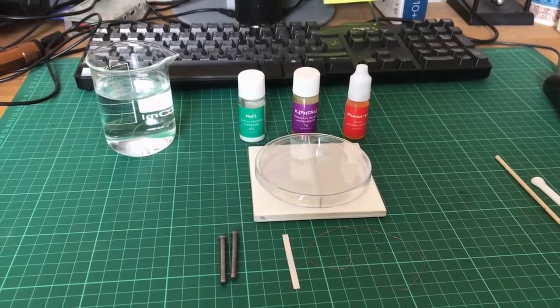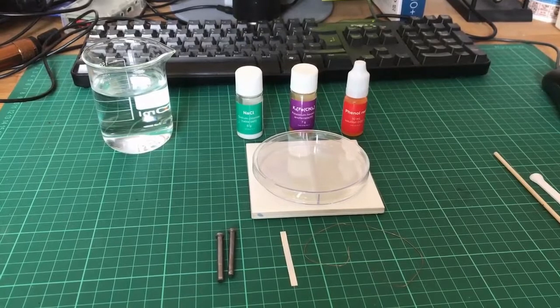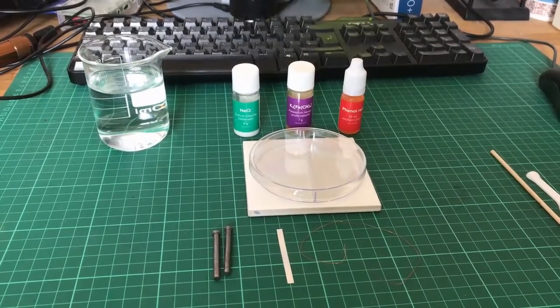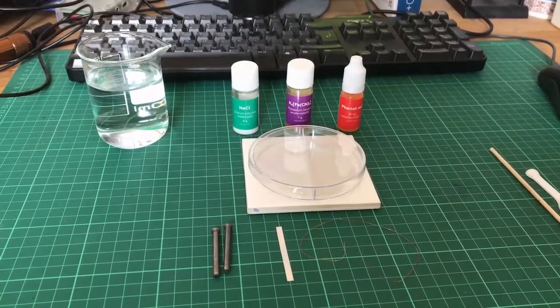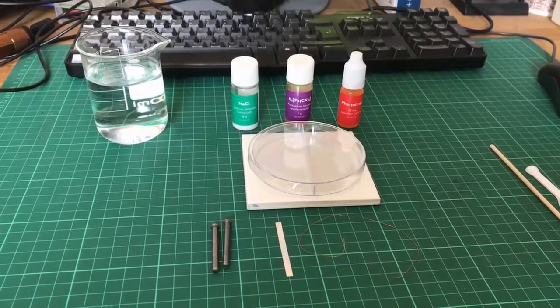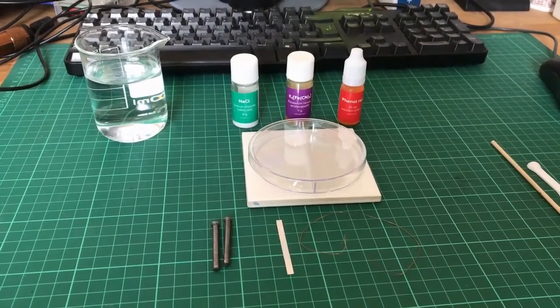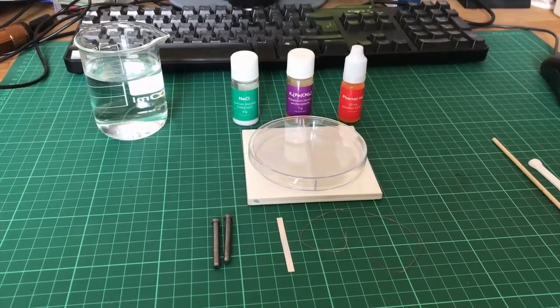In this experiment, we will be looking at a method for preventing the rusting of a metal by utilizing the electrons of another metal. Rust on an iron nail, for example, forms when oxygen grabs electrons from iron to form iron oxide. We can slow that reaction down by providing the oxygen with additional electrons from another source, in this case magnesium, which is a much more reactive metal and easily loses its electrons.